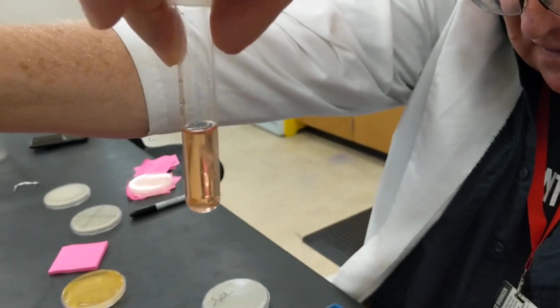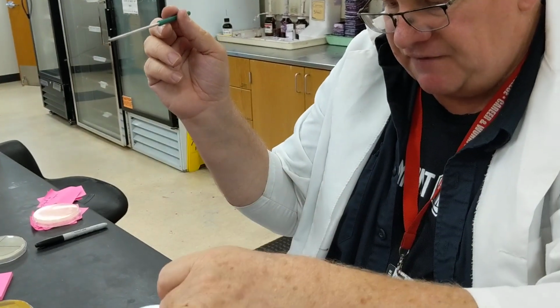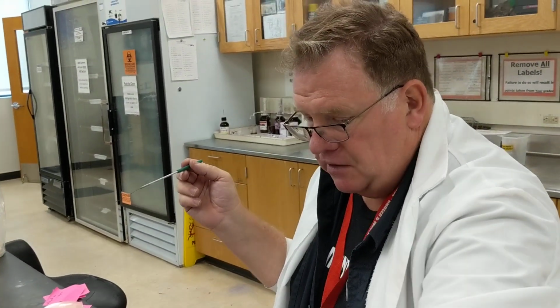Yeah. Kind of see it in there. Again, you don't have to click it around or click on the sides and stuff like that. You just need to make sure that it's on. All right, so we went from a plate to a liquid. Now, what are you going to do if you're going to go from a plate to a plate?